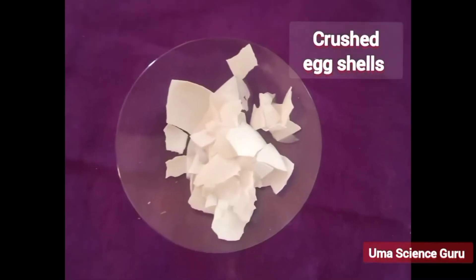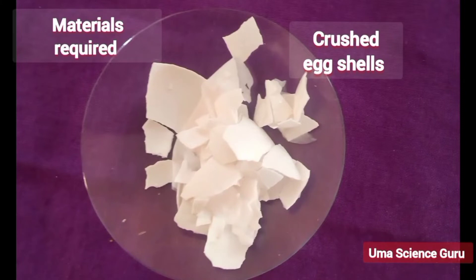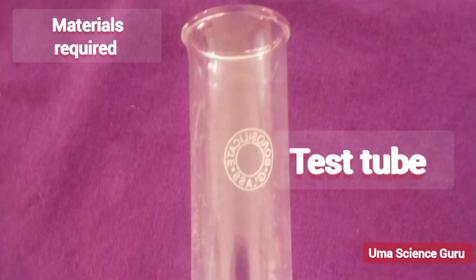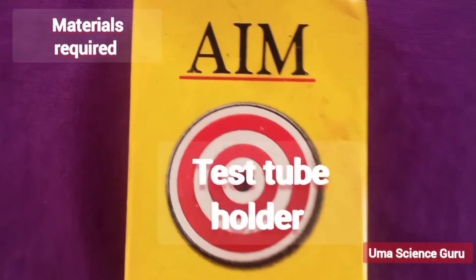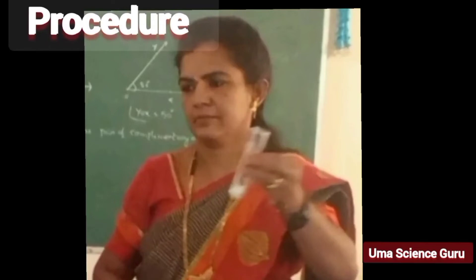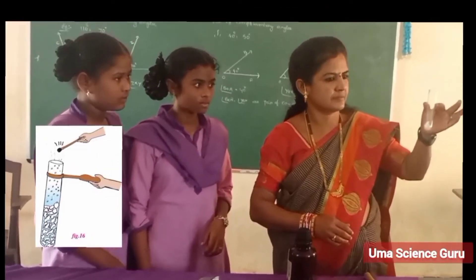Materials required for this experiment are: crushed eggshells, diluted hydrochloric acid, a test tube, a test tube holder, and a matchbox. Students, take some crushed eggshells in a test tube.